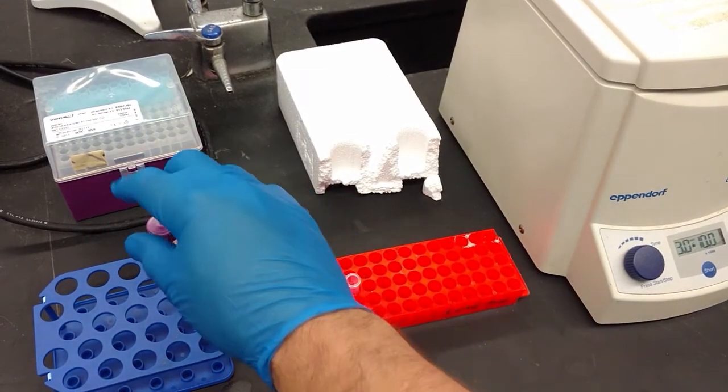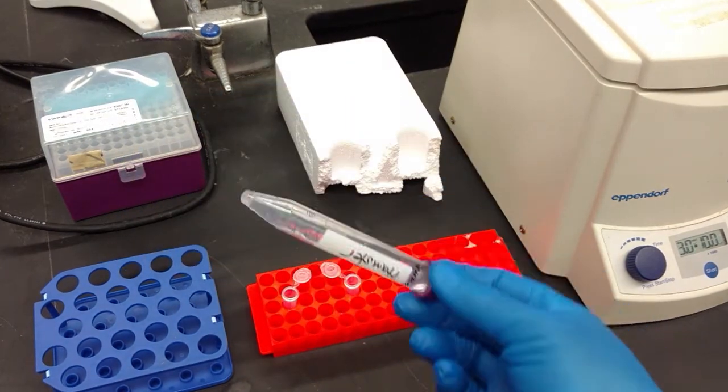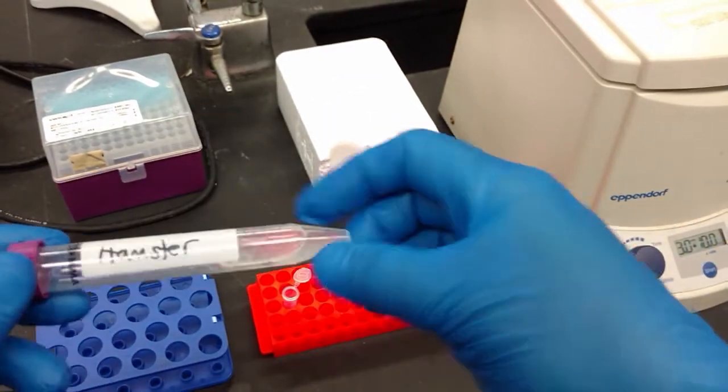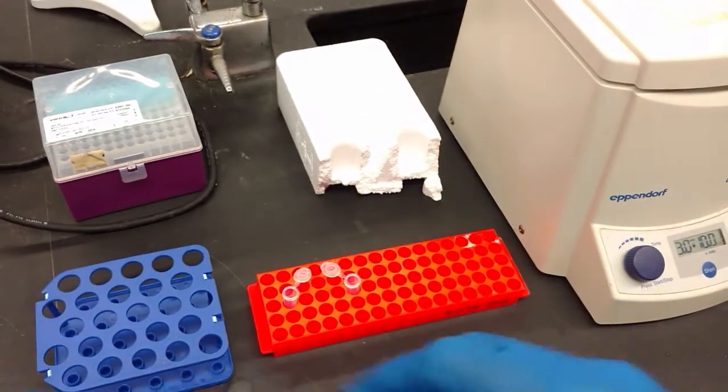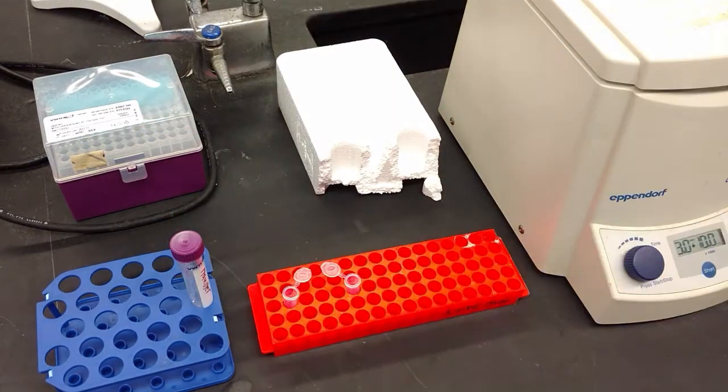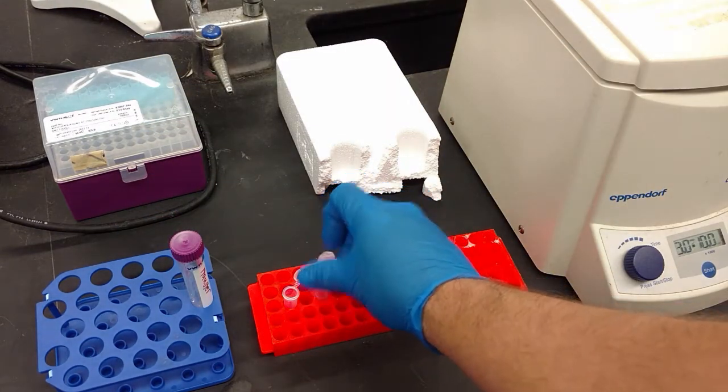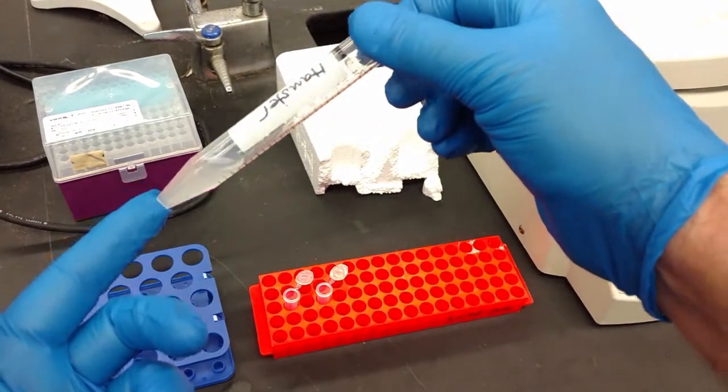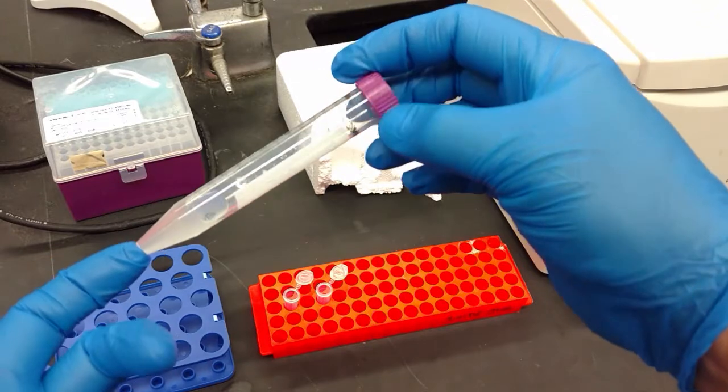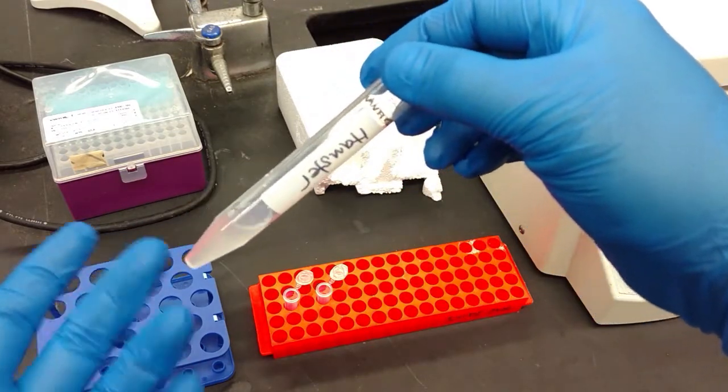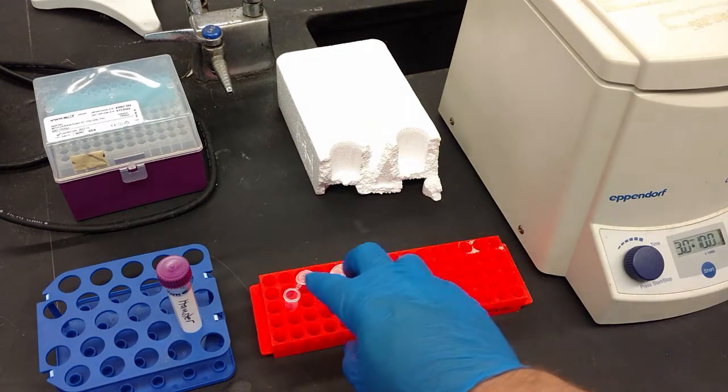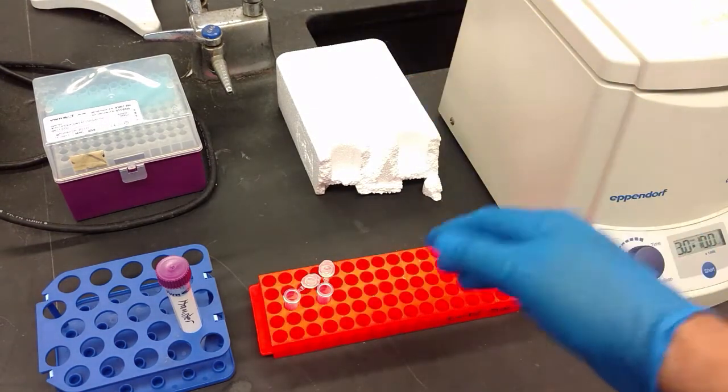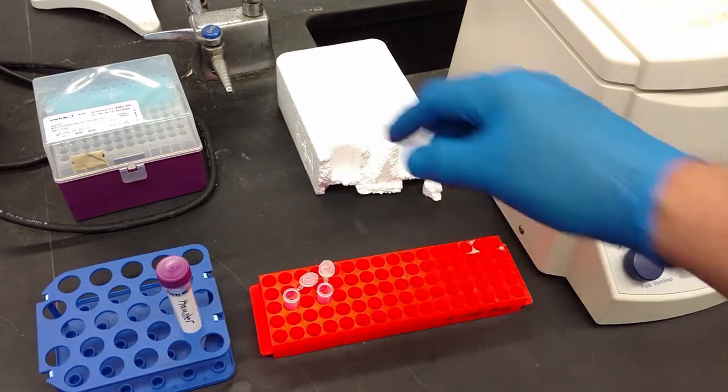We want to move to a place where we can continue working and get away from any potential DNase contamination. This guanidine thiocyanate just took care of the DNase that was in our sample. So we're going to work over here now at the bench. But one of the things you want to do is you want to change your gloves because they are potentially contaminated.